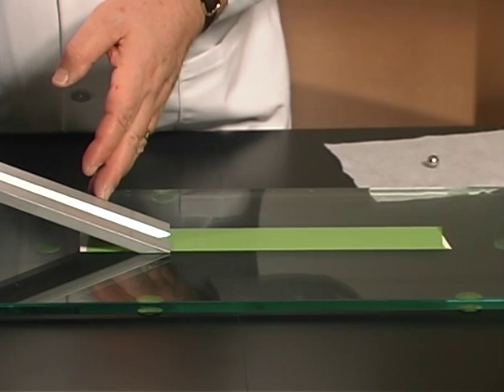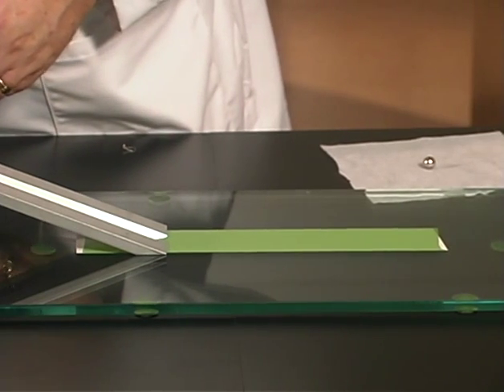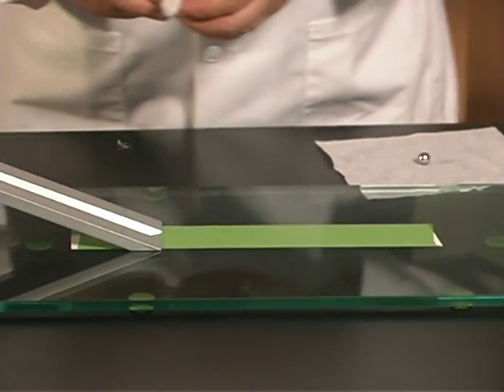Place the ramp near one end of the specimen so that at least 300mm of the sample remains clear.